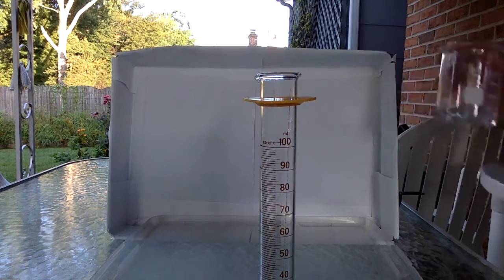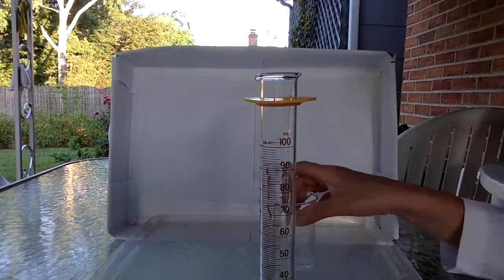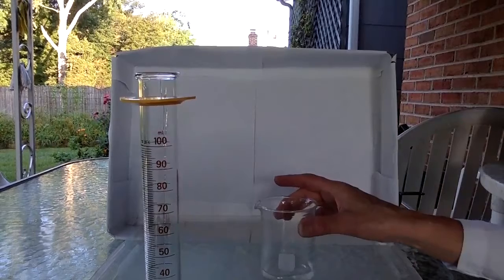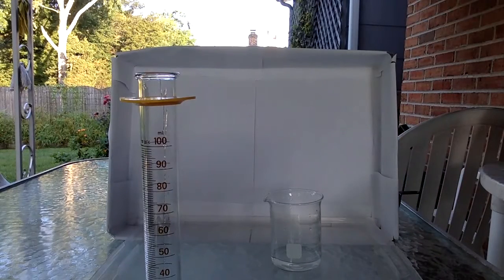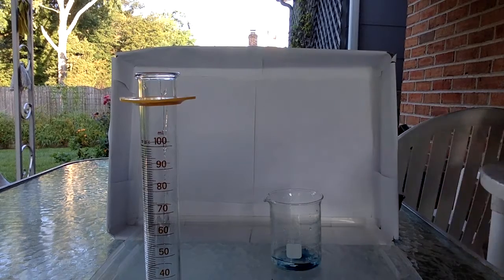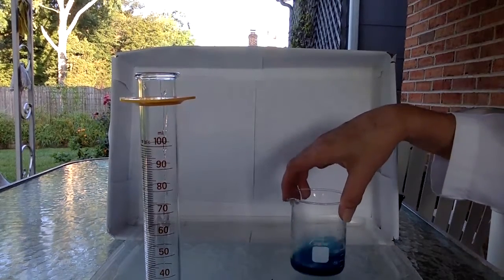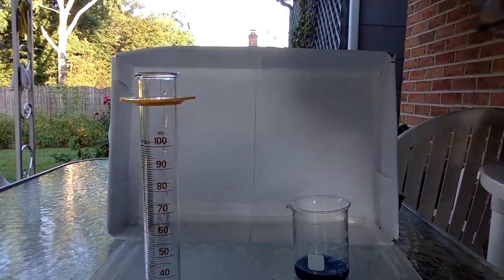All right, next we are going to use the water. I'm going to put a little blue in there so that you can see it, because the corn syrup is almost colorless and pretty clear. So 20 microliters of food coloring are not going to change the volume of the water that much.